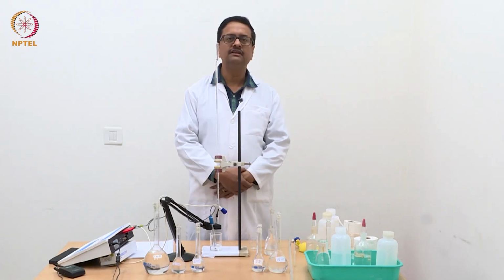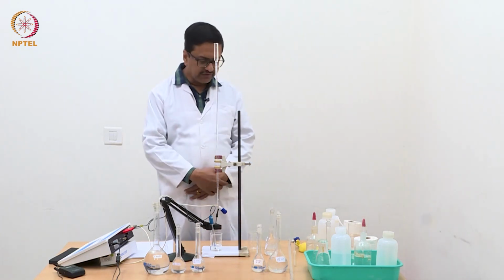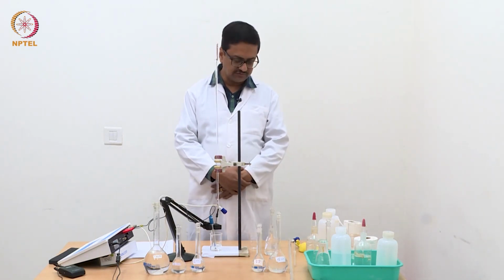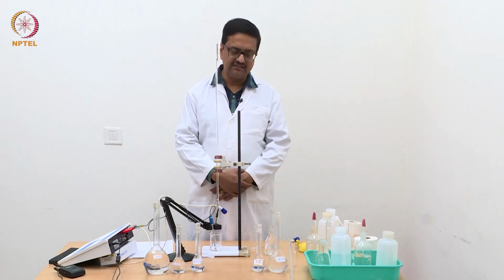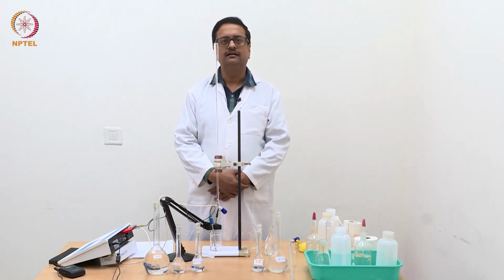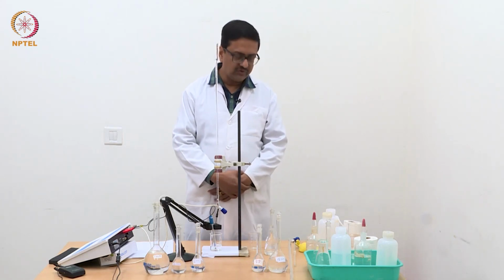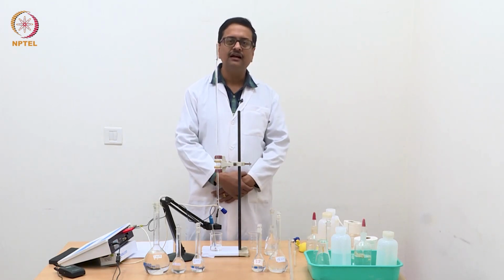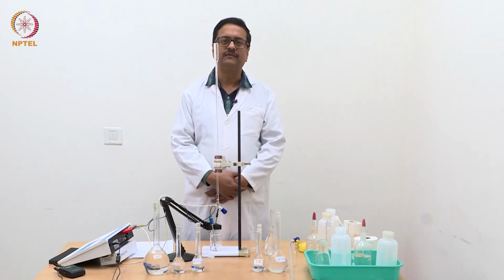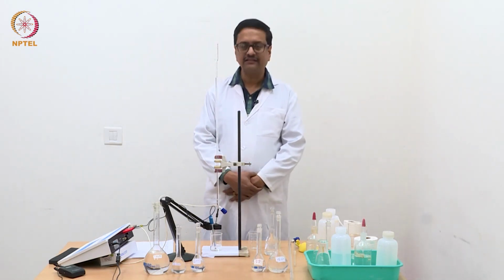Welcome back to the experimental session of the elementary electrochemistry course. In the previous few videos, we have shown you a few conductometric and potentiometric titrations, including two conductometric titrations: weak acid with strong base, and strong acid with strong base. And now, in this third experiment, we are going to combine two types of titrations.